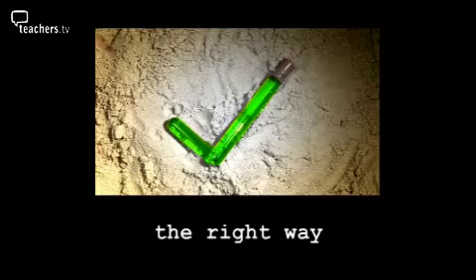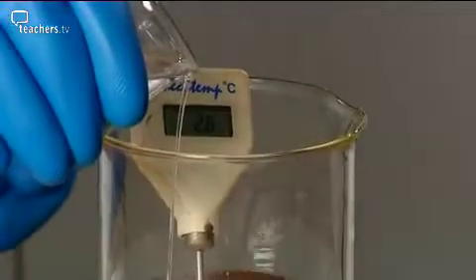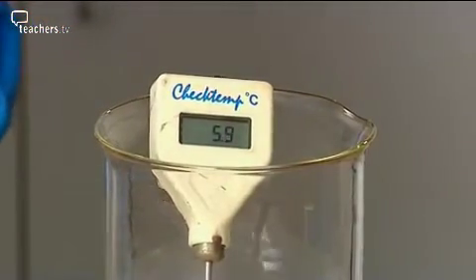The right way is to slowly add the concentrated sulfuric acid to water, preferably iced, mixing continuously. The temperature hardly changes.